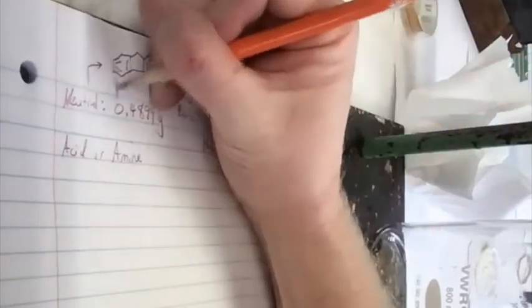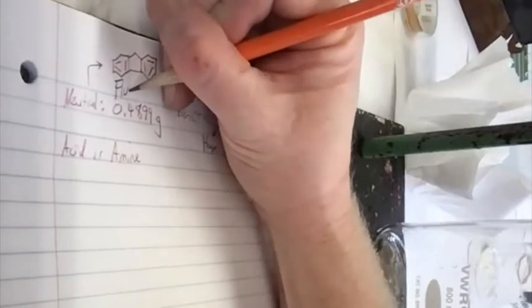The third one, the fluorene, or I forget exactly what it was called. Yeah, I can't name it either. Fluorene. It's weird. It felt like it had the fluorine atom on it, but it's not. But because it fluoresces. So yeah, it could be fluorene.